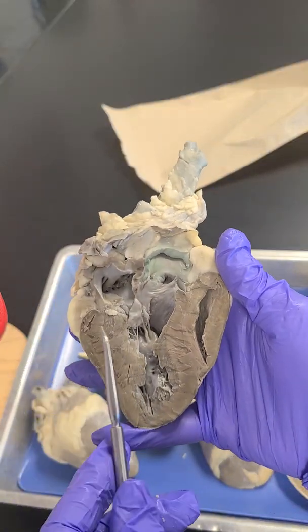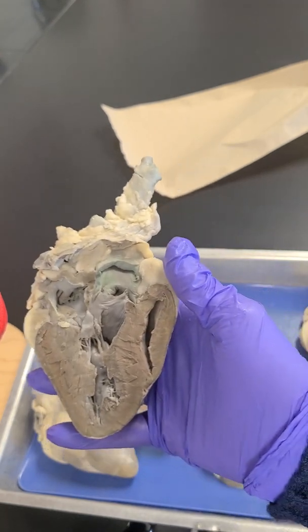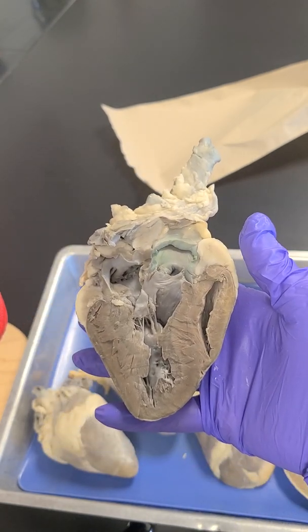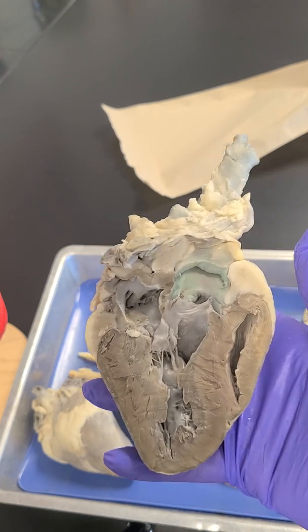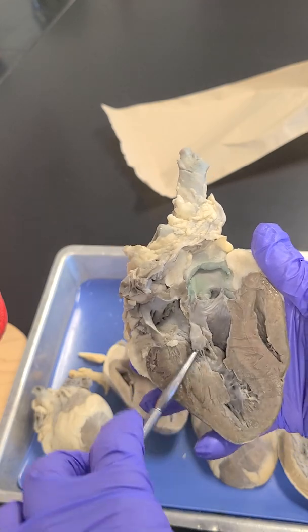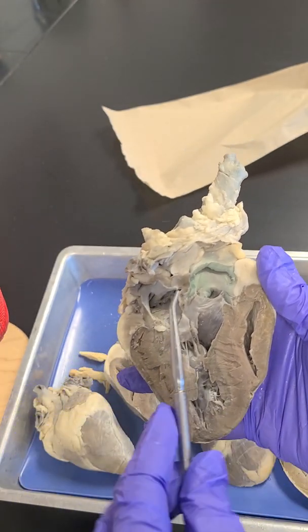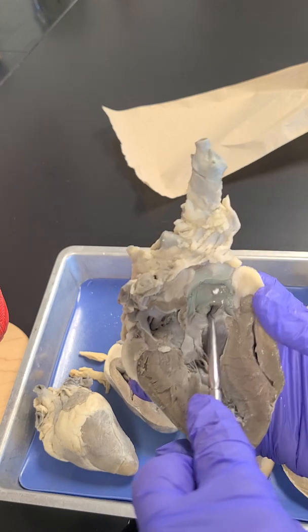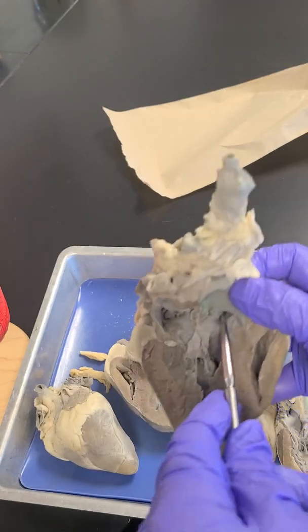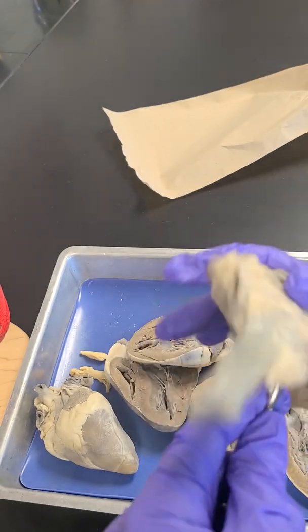Here's our last heart. So orient yourself. So you should be determining what's the left side of the heart and what's the right side of the heart. And where are my left ventricles and right ventricles and left atria and right atria? So I'll show you there's these right here. Okay, that's separating this. So this is a vessel right here. I don't want to know the name of this vessel, but I'll show you.